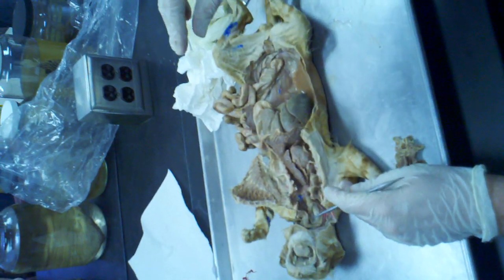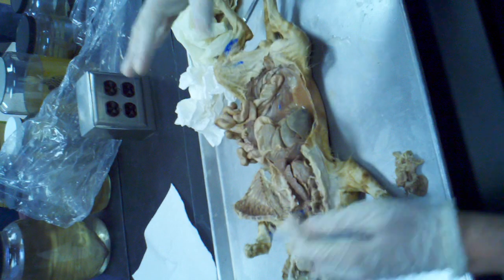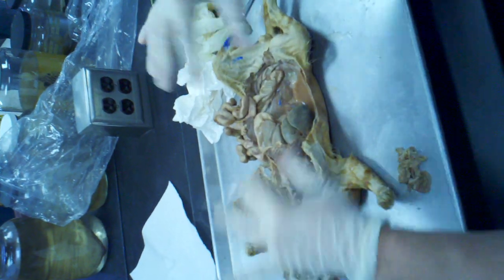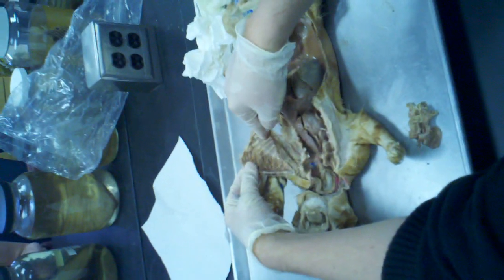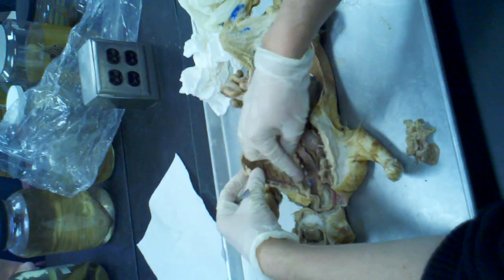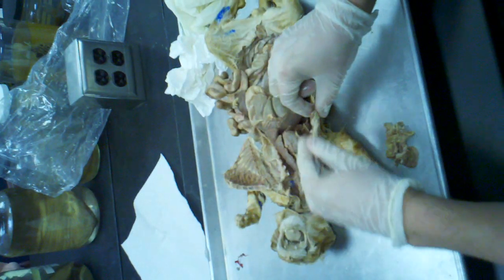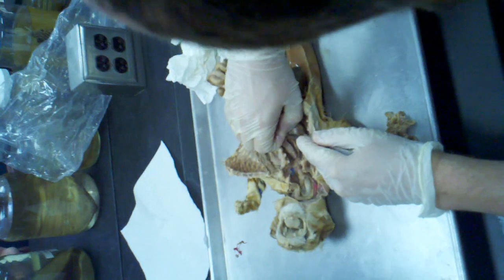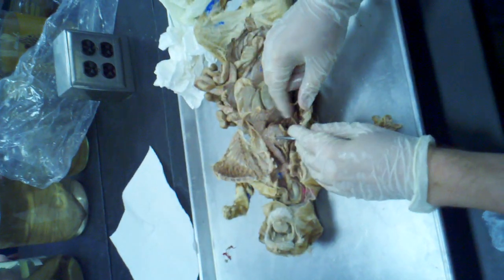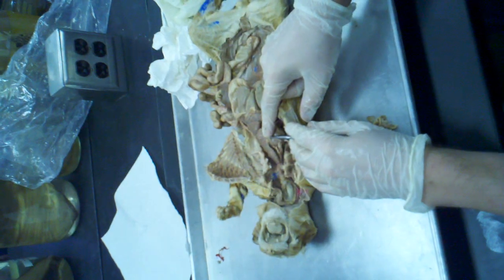If you put a pin right on the side of these cavities, on the outside of these cavities, so that would be either here, this would be called parietal. And since this is the pleural cavity, this is parietal pleura. Same thing over here. If I touch this pericardial cavity and this pericardial sac, this is called the parietal pericardium, the actual sac. Okay.